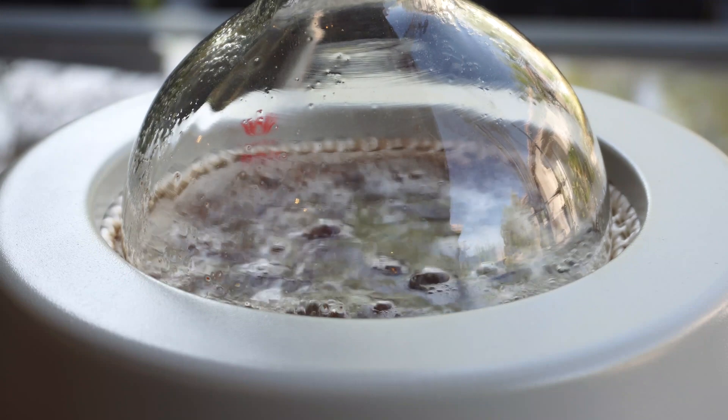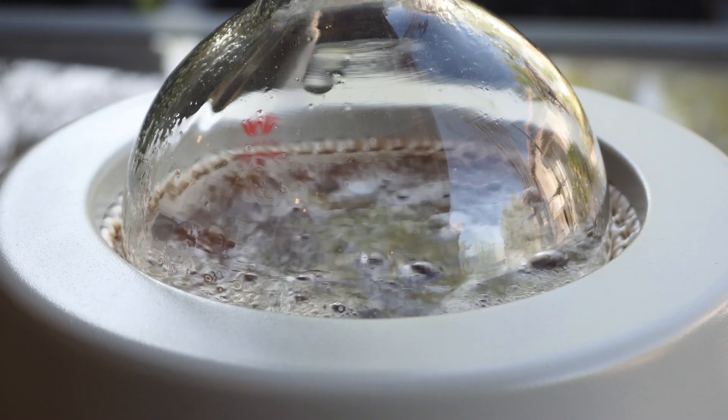Once the water starts boiling here, we can see that it is bubbling rapidly, but not foaming.